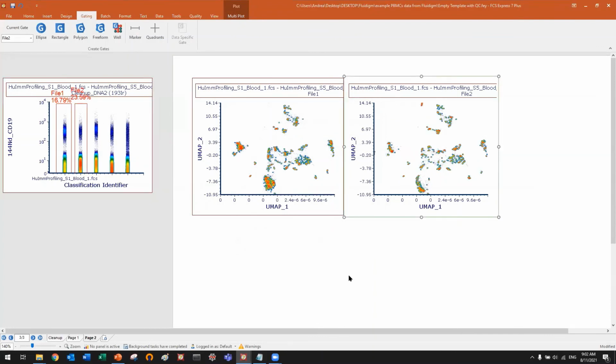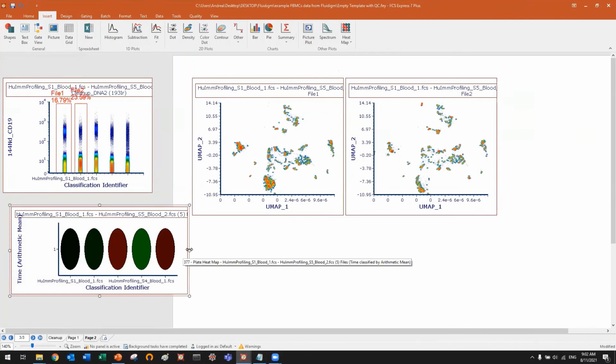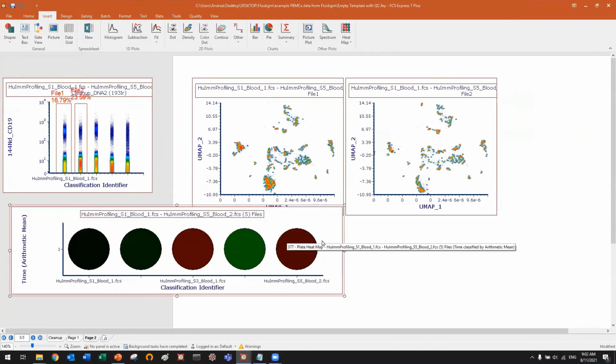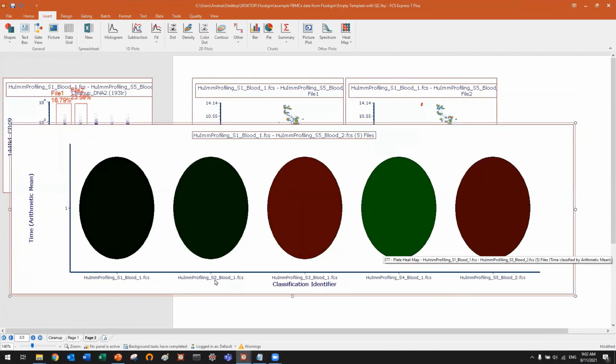Okay, and now I can apply file number 2 here. So you can do this if you want to create a nice picture. Okay, there are also other ways in which you can automatically create this type of gates. But again, we have so many things. You see here, I can display my 5 files as a virtual multi-well plate. In this case, I have 5, so I have a 5-well plate. You see well 1, well 2, well 3, well 4, well 5. Okay, each well is a file.